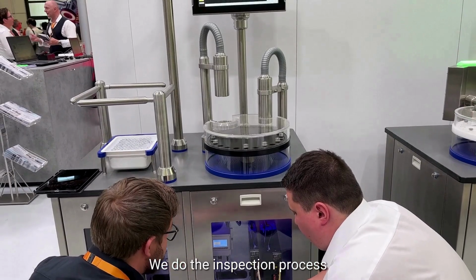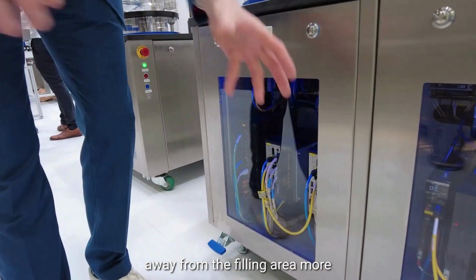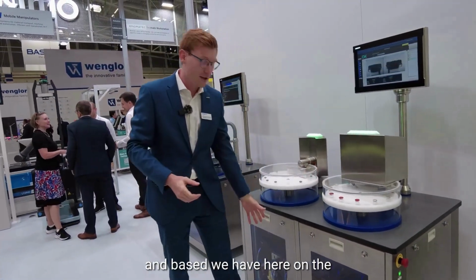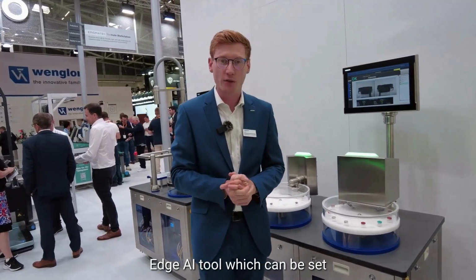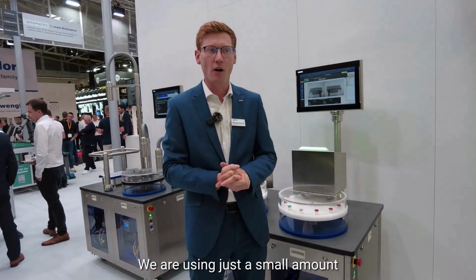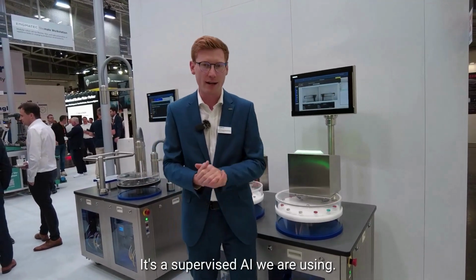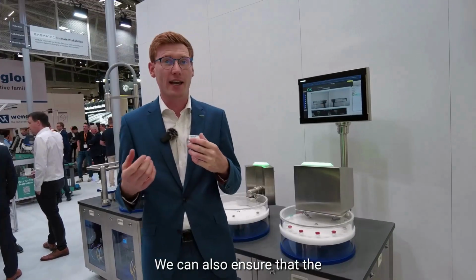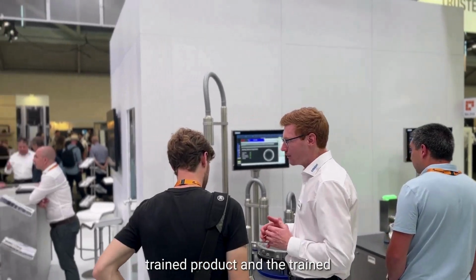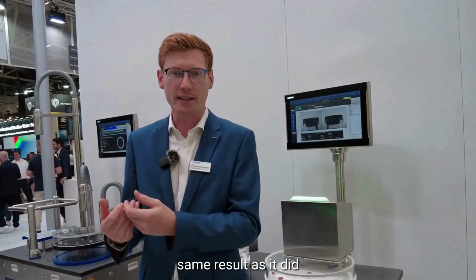We do the inspection process and the calculation process away from the filling area, more in the electrical cabinet of the machine. And on the controller we also have an Edge AI tool running, which can be set up quite easily. We are using just a small amount of good and not good parts as reference parts. It's a supervised AI we are using. We can also ensure that the trained product and the trained system all the time delivers the same result as it did during the training.